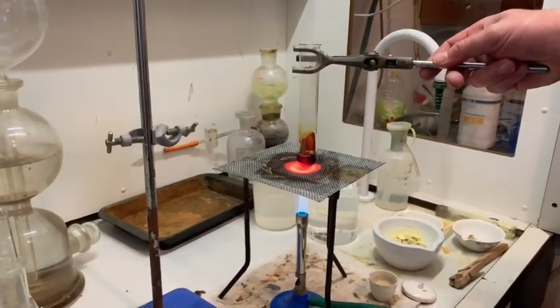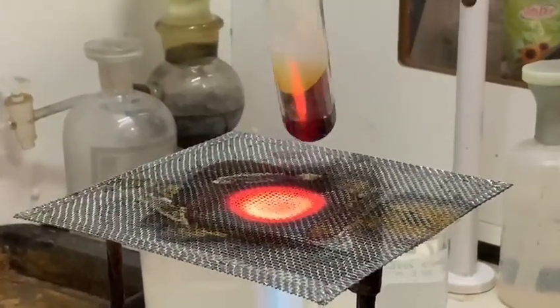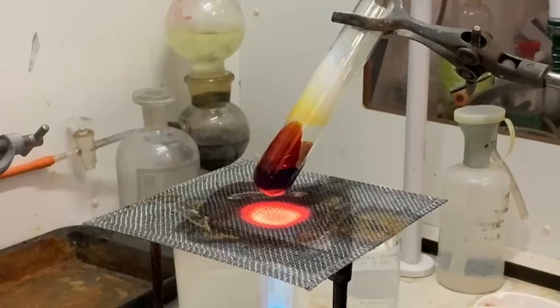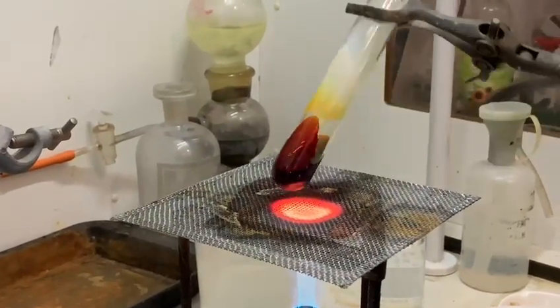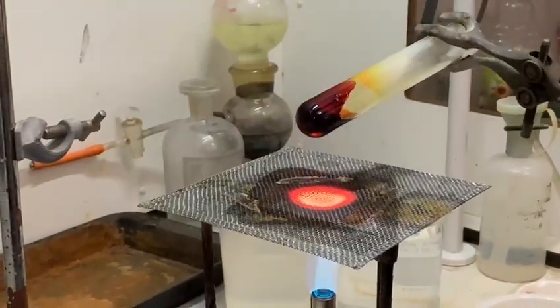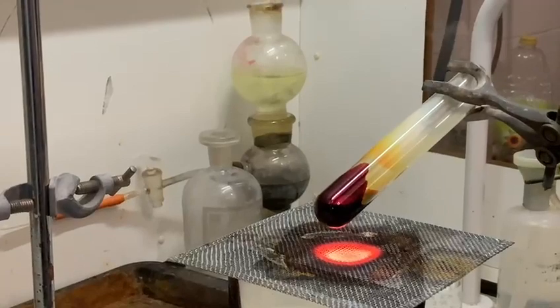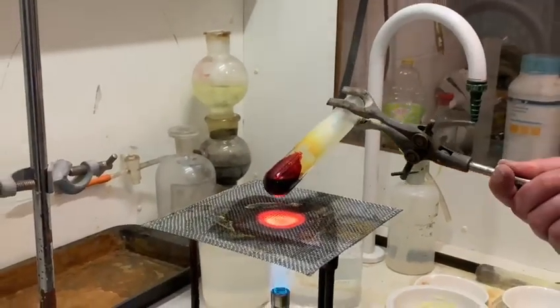What's happening is the sulfur has melted. Sulfur normally consists of molecules of about eight atoms — S8 — and those eight atoms begin to stretch and move as it's heated up. We can see that the yellow sulfur has turned into a very dark brown viscous liquid at about 160 degrees. You can see vapor coming off, and also yellow sublimation happening here.